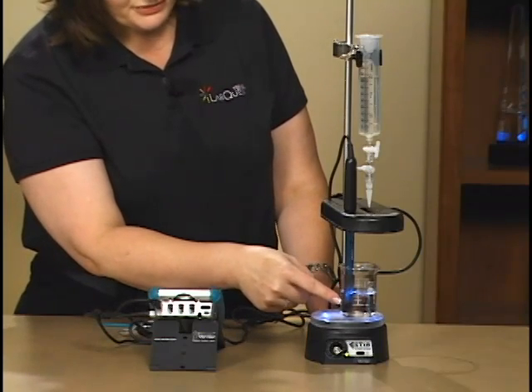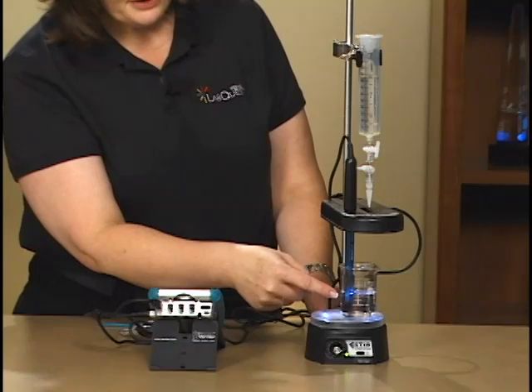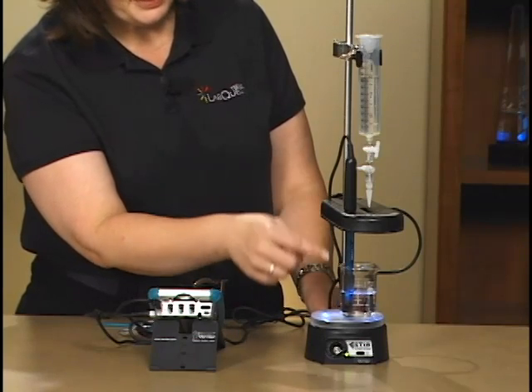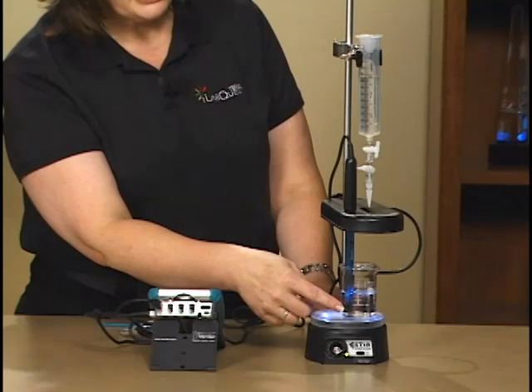So we have a micro stir here which has a little paddle wheel on the bottom of the pH sensor that we have in our hydrochloric acid solution.